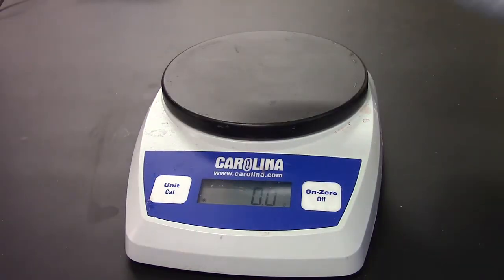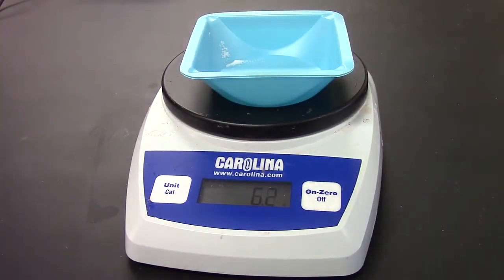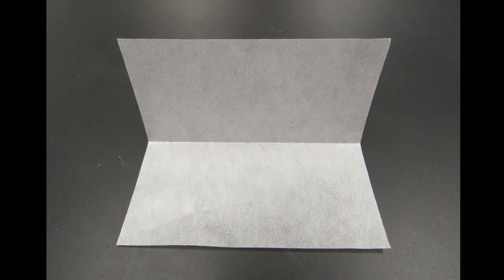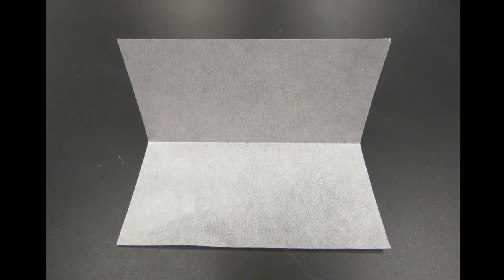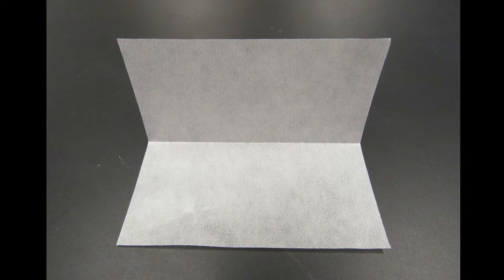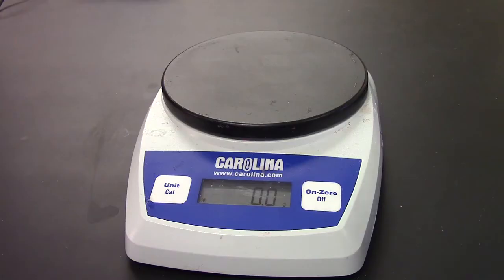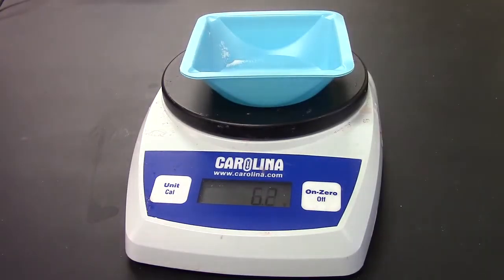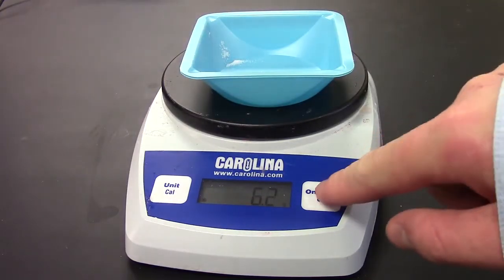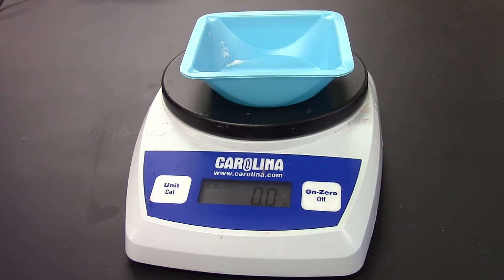Then you can place whatever you're using to hold the substance on top. If it's a small amount, you can use a piece of weigh paper. If it's a larger amount, you can use this little container called a boat. Oh, not that boat! This boat! Then you want to press the button to set the weight to zero so that you only get the weight of the substance that you're measuring.